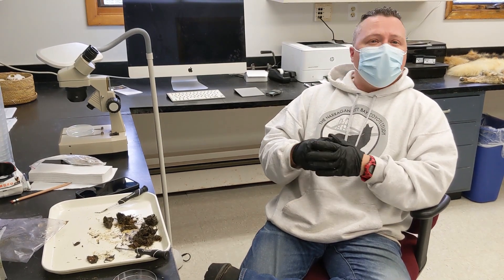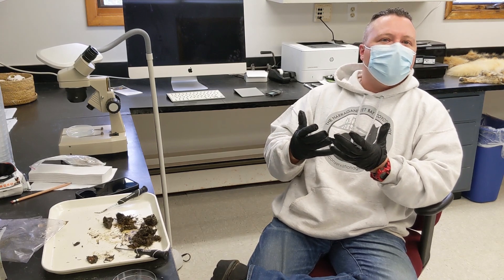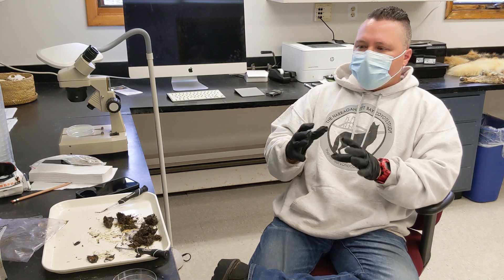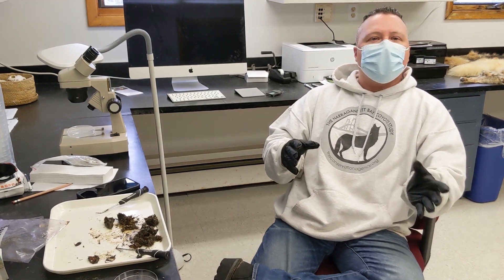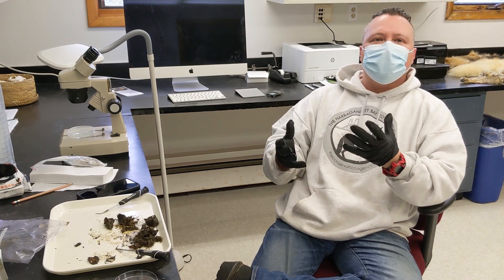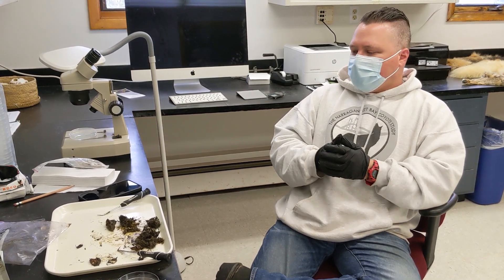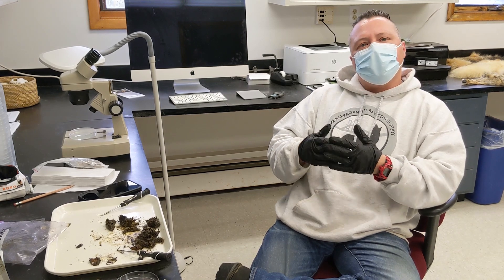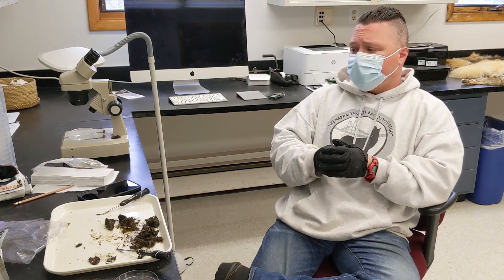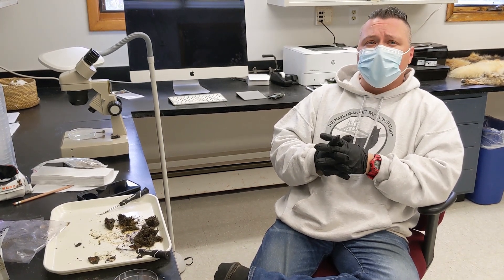The main thing we'll do is wash out the matrix, which is essentially the meat that they were eating, which may be identifiable perhaps by color — we don't know yet. Beyond that, there's not much you can do with the matrix. Once we've weighed it and have everything we need from it, we'll wash that out and just have the undigestible material remaining.